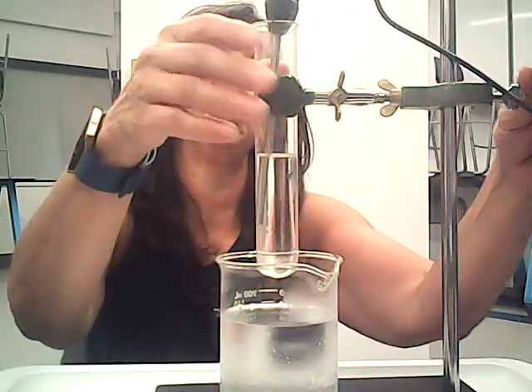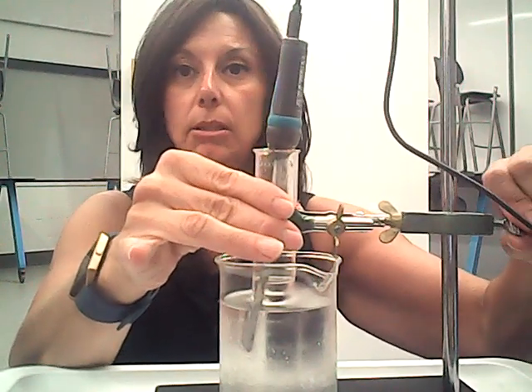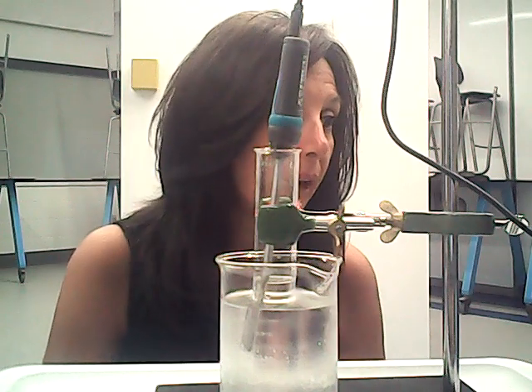So the beginning temperature is 31.4. That's above room temperature. And we are now slipping it into the cold water. I'm going to leave the video on for just a little bit. We have the collection going at every 30 seconds. It's going to record the temperature of this lauric acid every 30 seconds for 900 seconds. Like I said, we'll get the data for your data chart once we're done. After 30 seconds, it has dropped down to 29.4 degrees. So we're just halfway into a minute, and we have dropped down a little bit.